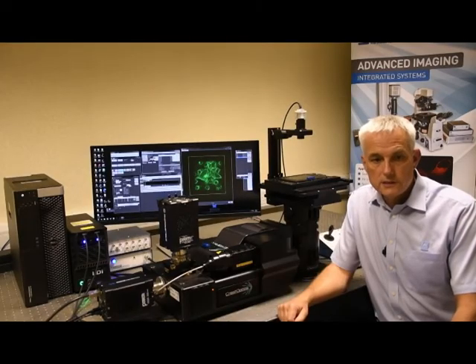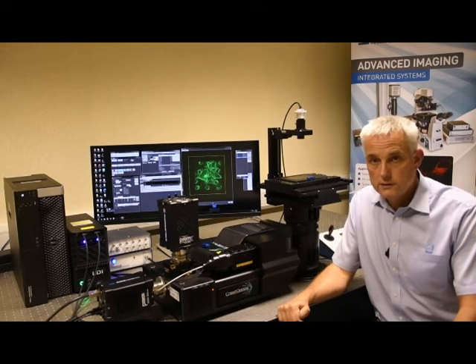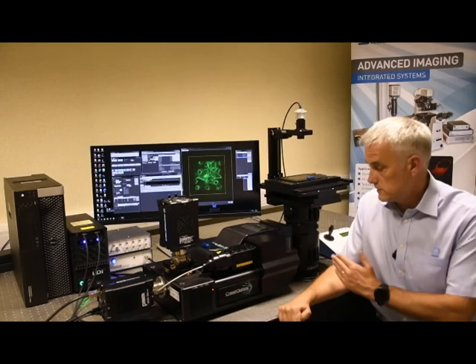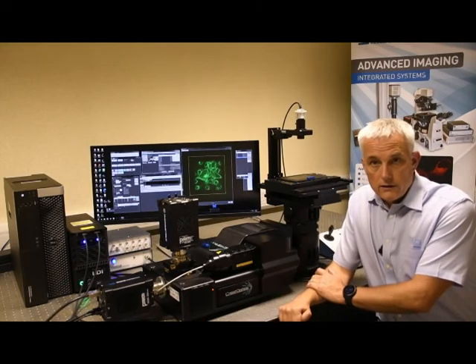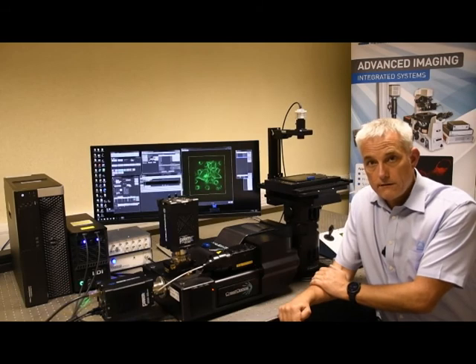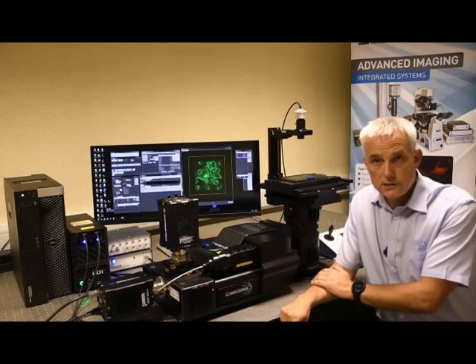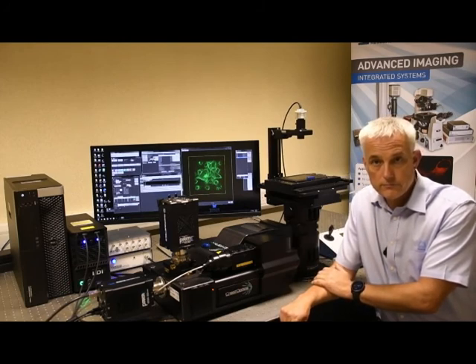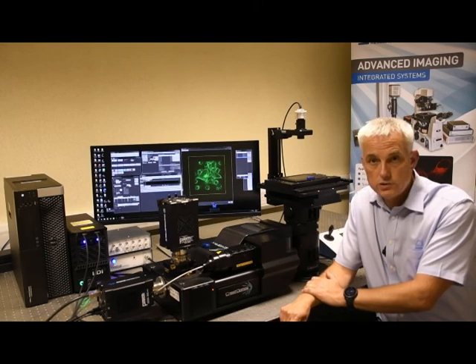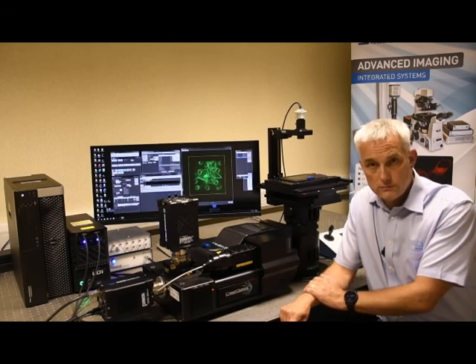So that covers all the main features of the spinning disk unit. I hope I've shown you in this short presentation the versatility built into the Crest confocal unit, and the flexibility we offer with the Cairn configurations and the Cairn stand. The Crest system can be offered as a complete system as shown here, or we can integrate it together with commercial frames such as the Nikon TI2, which we commonly use. Alternatively, we can offer it as a standalone upgrade for any research-grade commercial frame that has a C-mount or F-mount side port available.